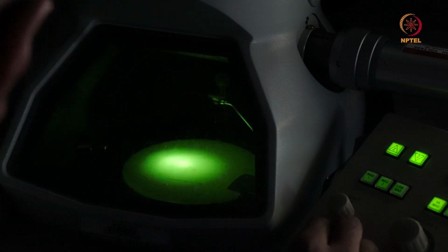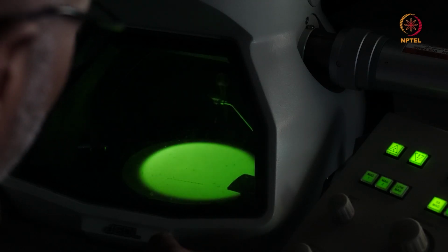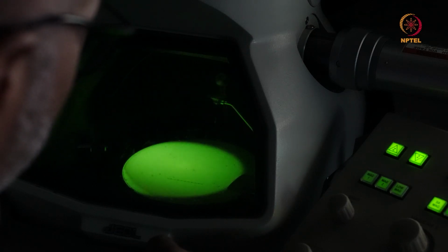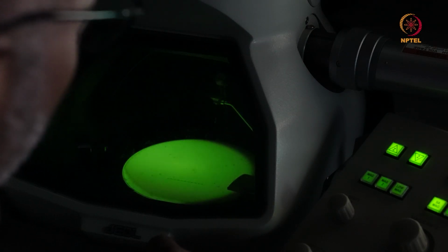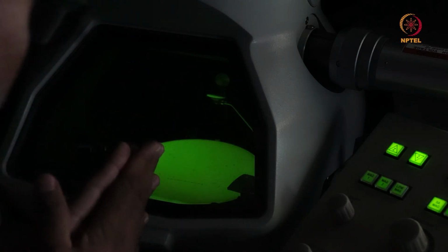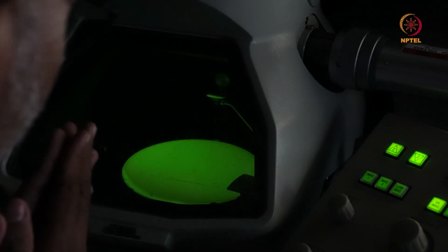So if I use a larger amplitude for the intensity knob now, or a larger step size, I see that on either side of the crossover, it is more or less coincident at the same point. In this condition, my aperture is aligned, and I've also shown you that the condenser stigmatism is sort of corrected.